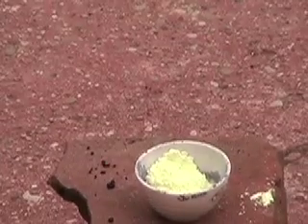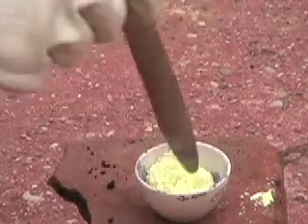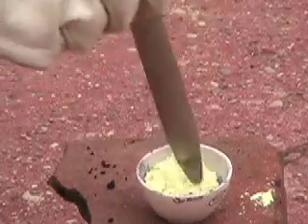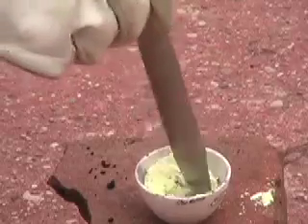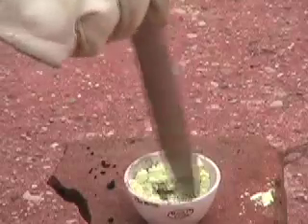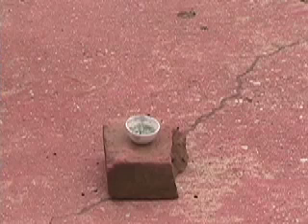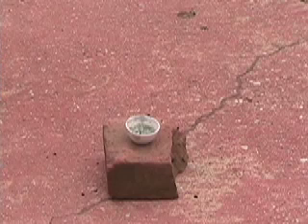I am now going to make some zinc sulfide by reacting elemental zinc and elemental sulfur. I am now mixing the two chemicals, and I'll get back to you when they're thoroughly mixed. I will now ignite my propane torch.